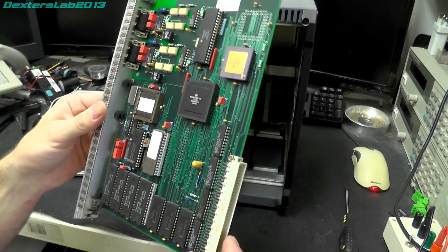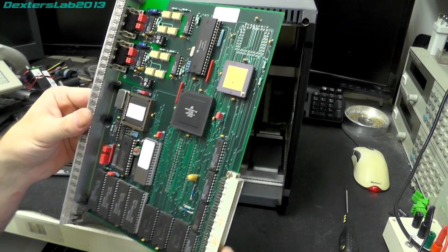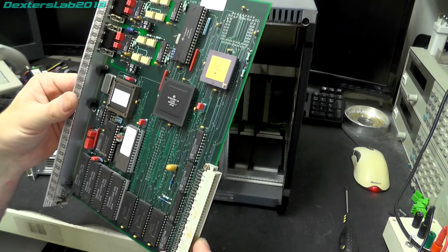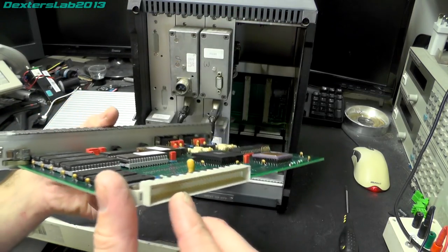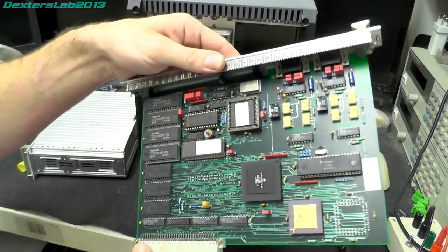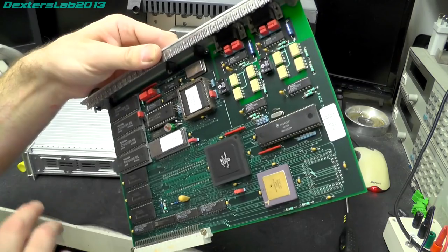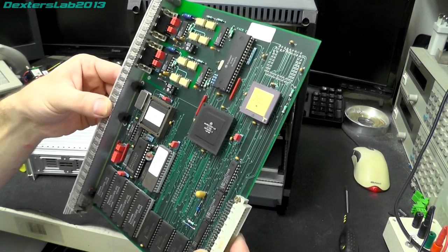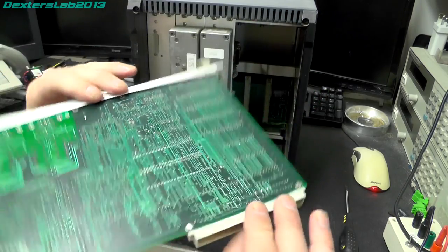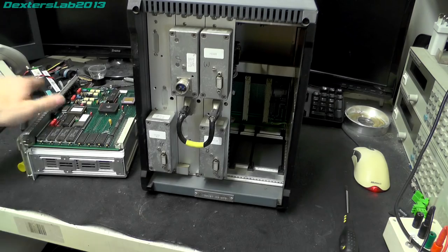So yeah, it looks like one of the CPU cards of some description. We have a Motorola 68020. So yeah, they needed a bit of grunt in this system. We've got what looks like memory down there, ROM. That's quite a compact board for a 68000 system, complete. Okay, we'll have a look at that in a minute.